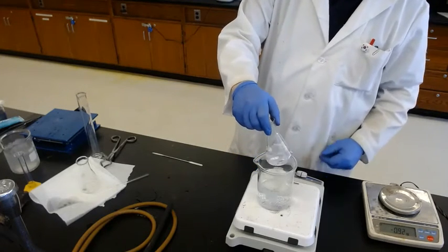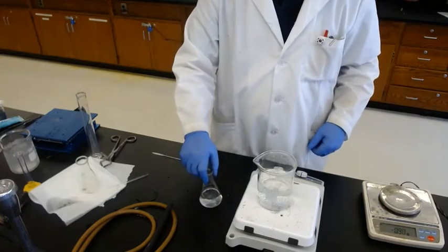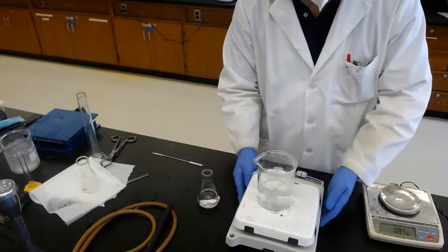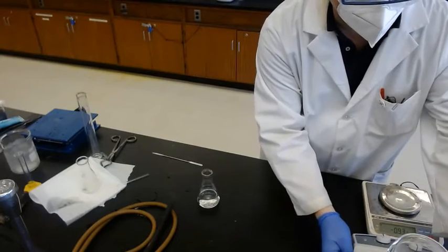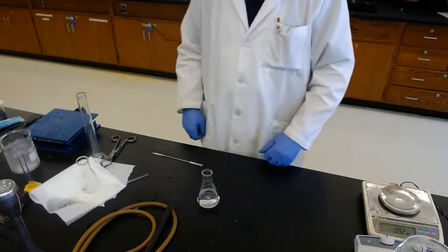So now it's cooling to room temperature. Okay, so slowly cooling it. And we don't need the hot water bath, move it to the side. And waiting until it's crystallized.